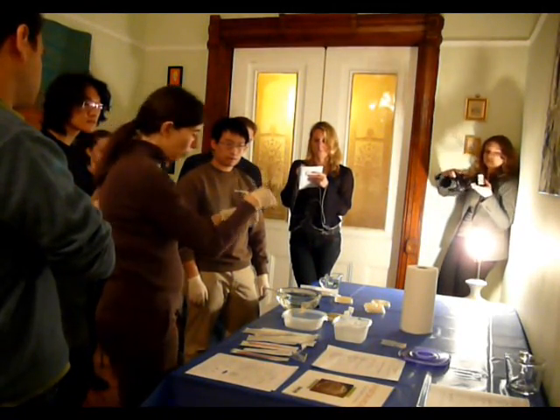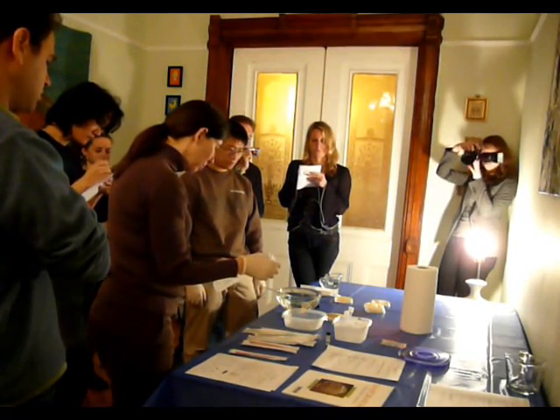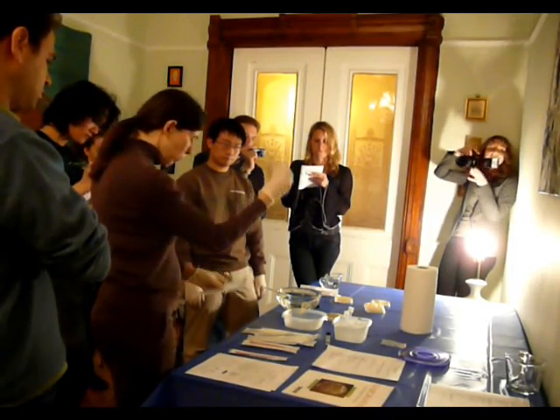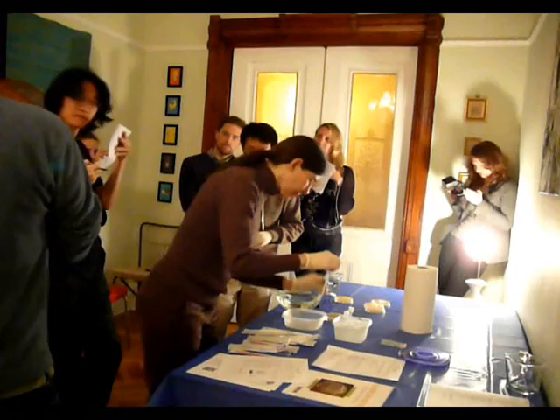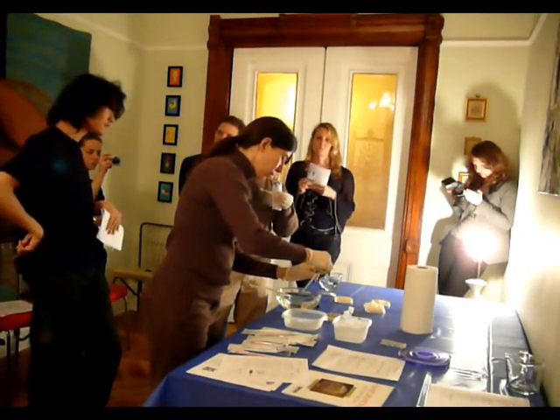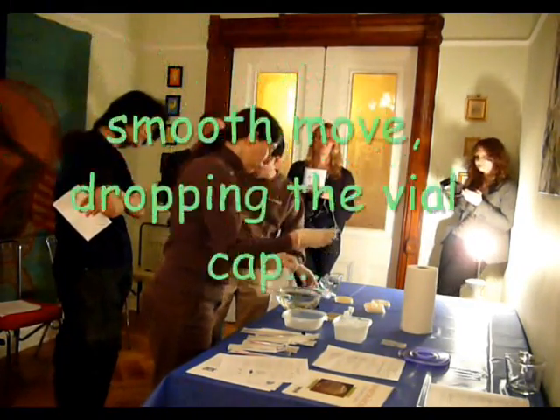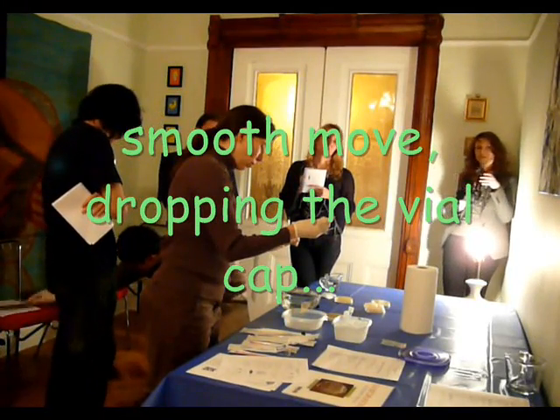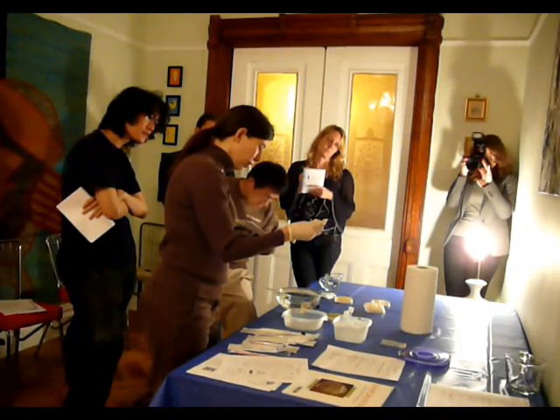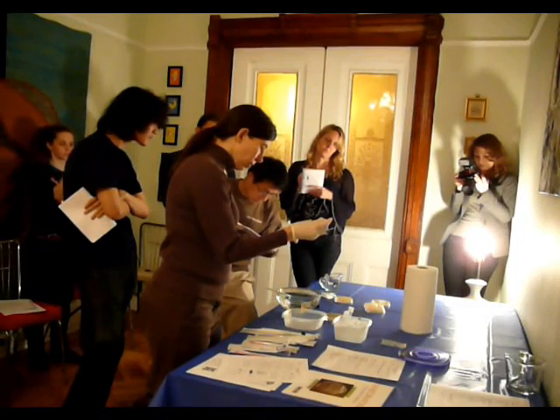So this is the calcium chloride — you have quite a bit of it. What I'm going to do is take this transfer pipette and make sure that the tip of it doesn't touch anything, because that's the sterile part. The first one is 100 and the second one is 100.